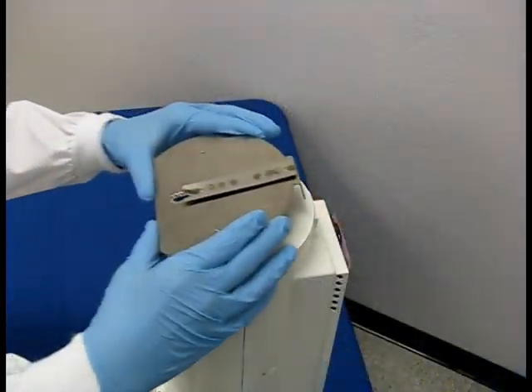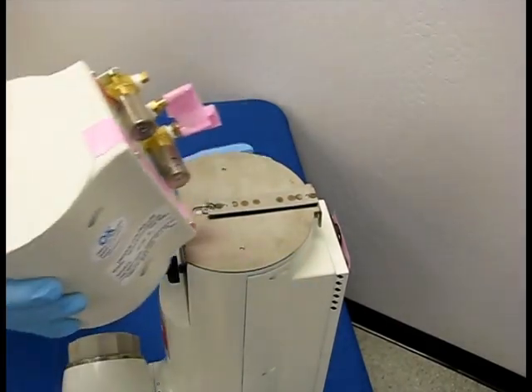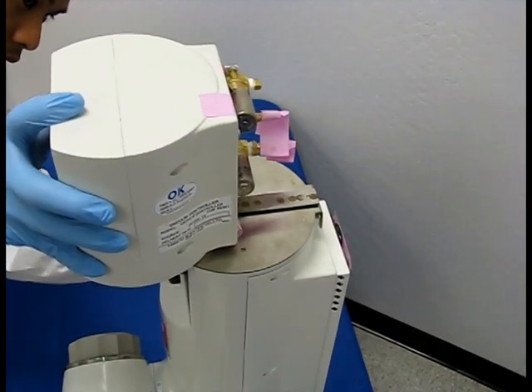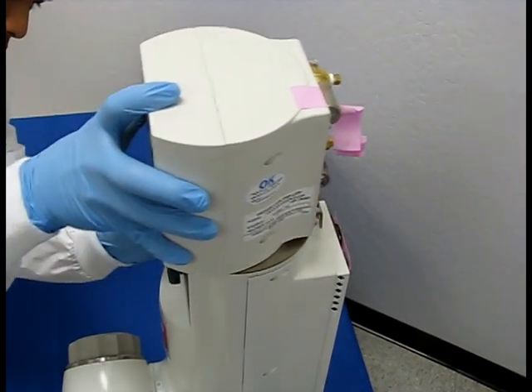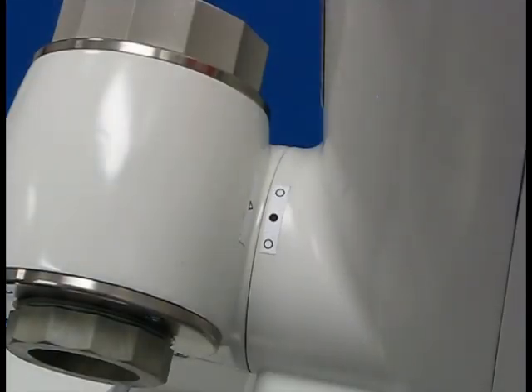Mount the bracket for the VR601 vacuum controller on top of the main unit. Mount the vacuum controller in place by sliding the rail of the bracket through the slot underneath the vacuum controller. Make sure that the motor and main body are properly positioned by checking the alignment indicators.